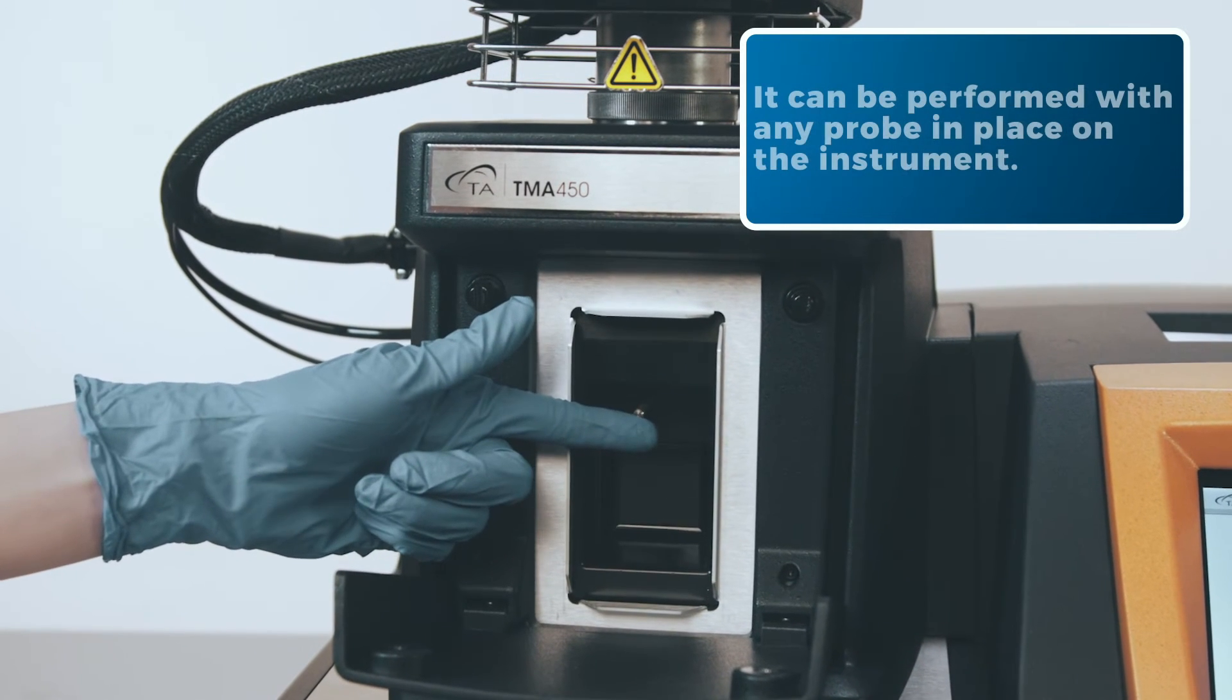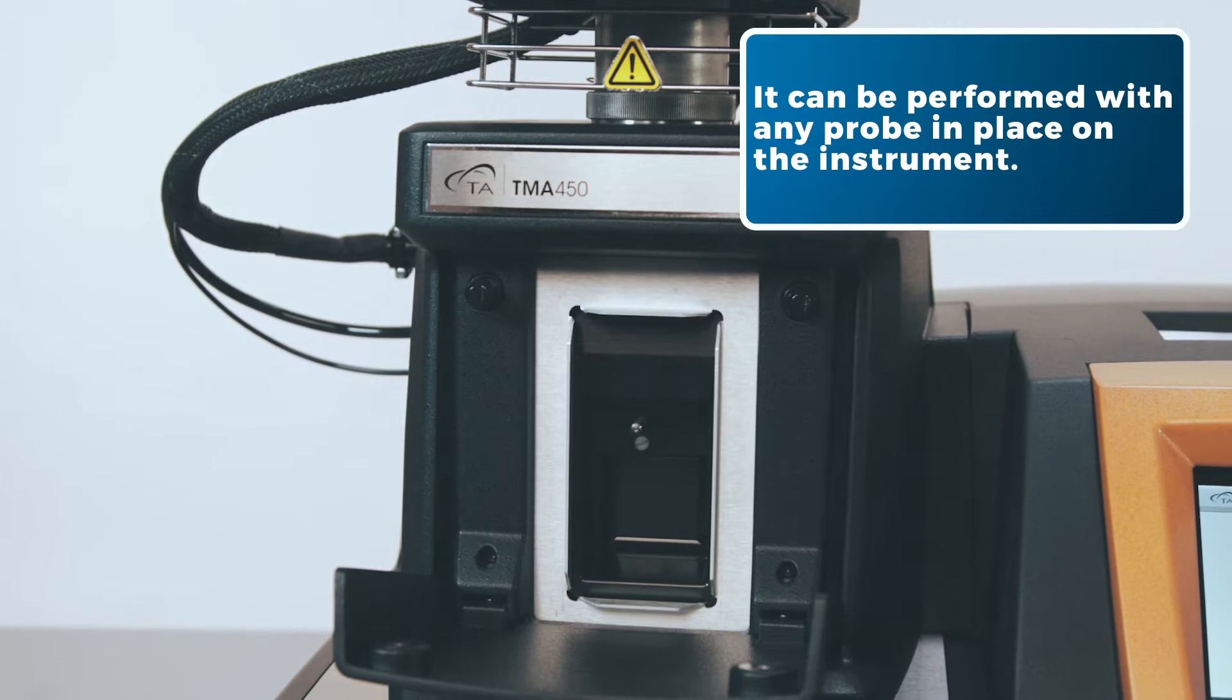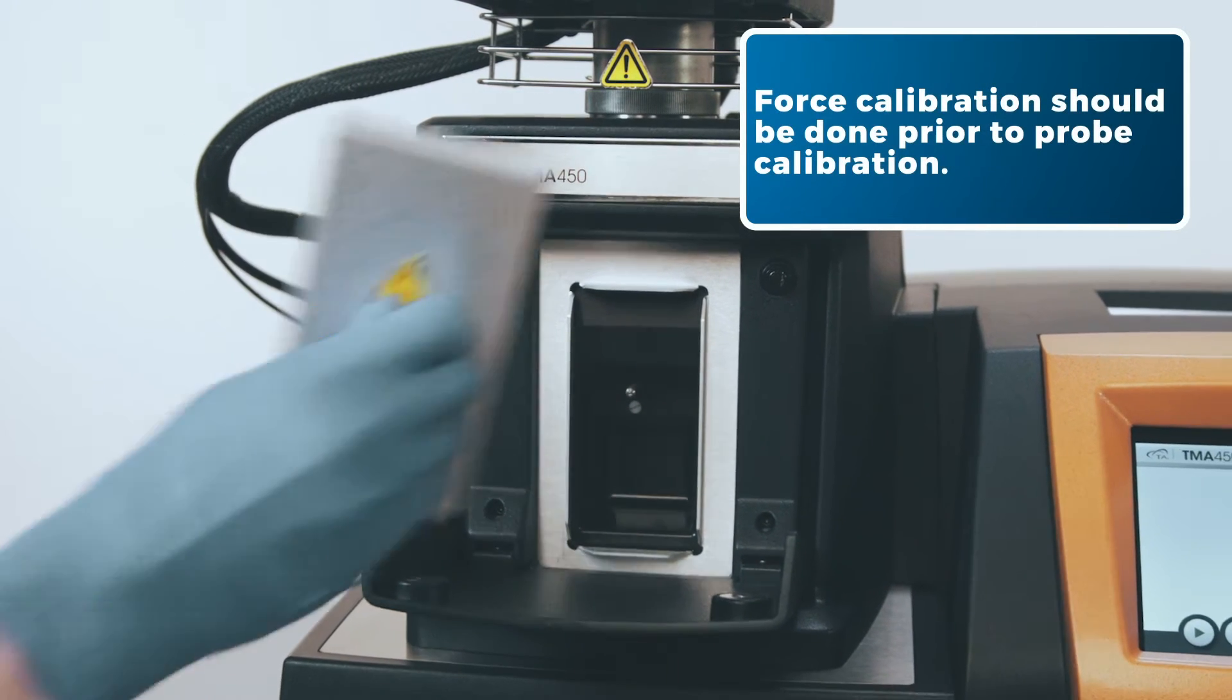It can be performed with any probe in place on the instrument. Force calibration should be done prior to probe calibration.